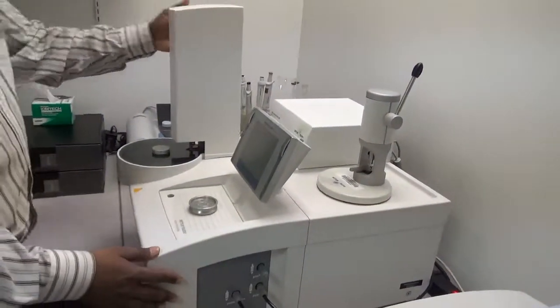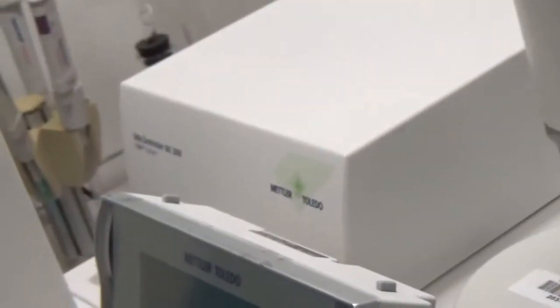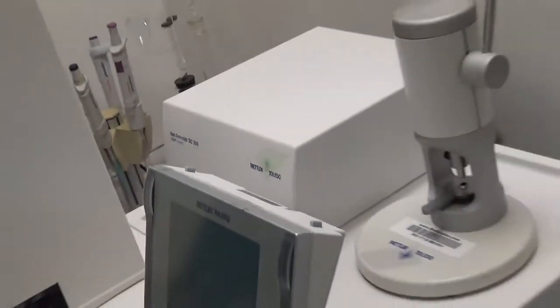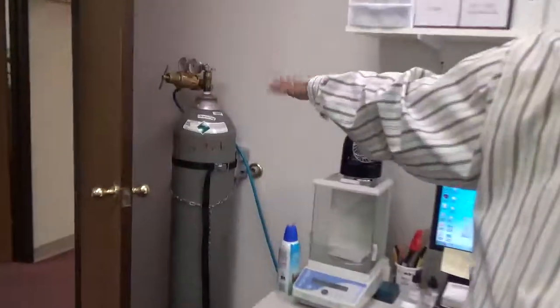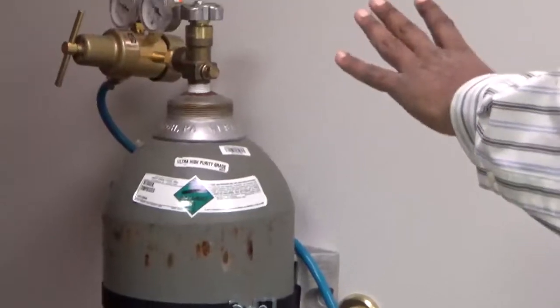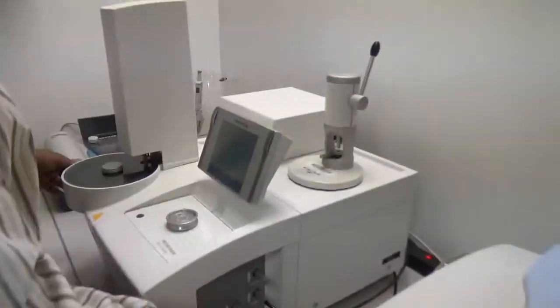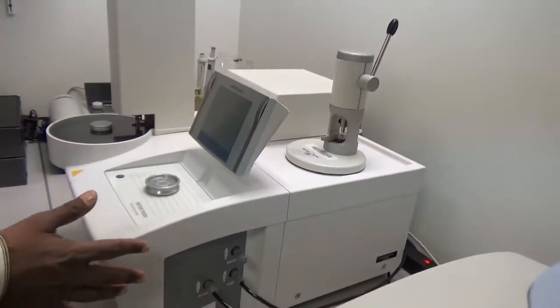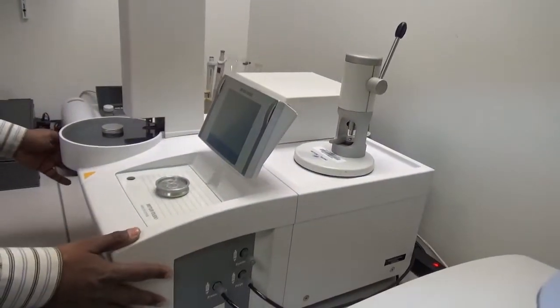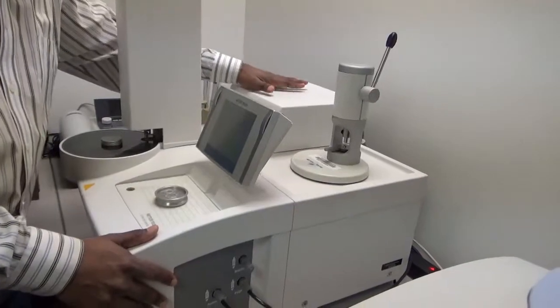This machine comes with a gas controller which controls the gas. We have pure nitrogen gas which comes from this tank, which gives the ultra-pure nitrogen. That ultra-pure nitrogen is used as a purge gas, and it comes to this inlet where the gas flushes the system. This gas controller controls the gas coming in.